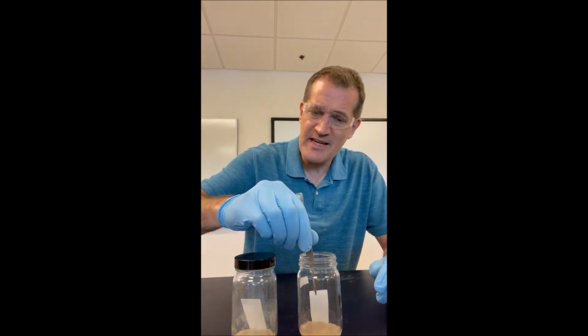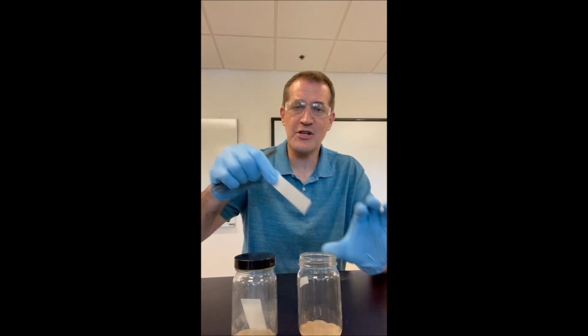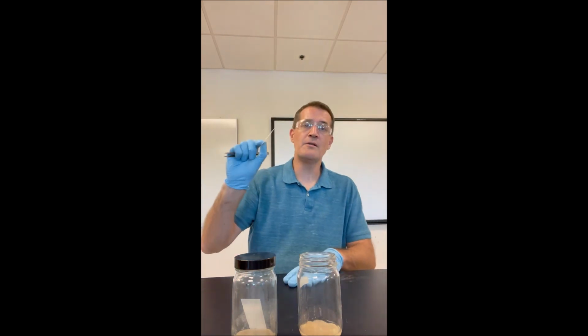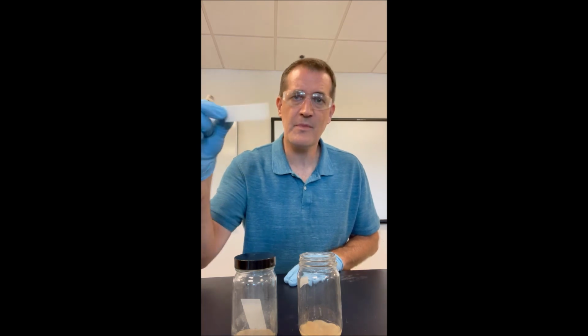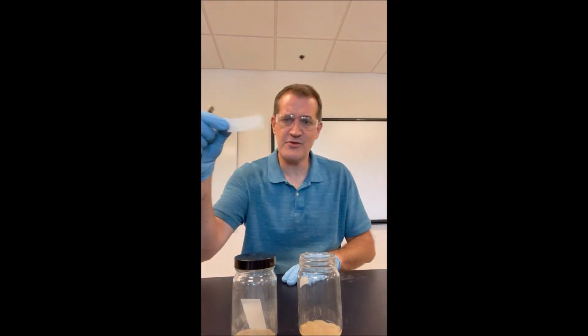I'm using the tweezers to take it out. And because this is full of solvent, I'm just gonna shake it because I want that solvent to come off, and I just want it to dry. There's no point in putting this under the UV lamp with lots of wet solvent on it because it's just gonna look like a mess. So I'm just gonna let this dry. Gonna take just a little bit to dry.